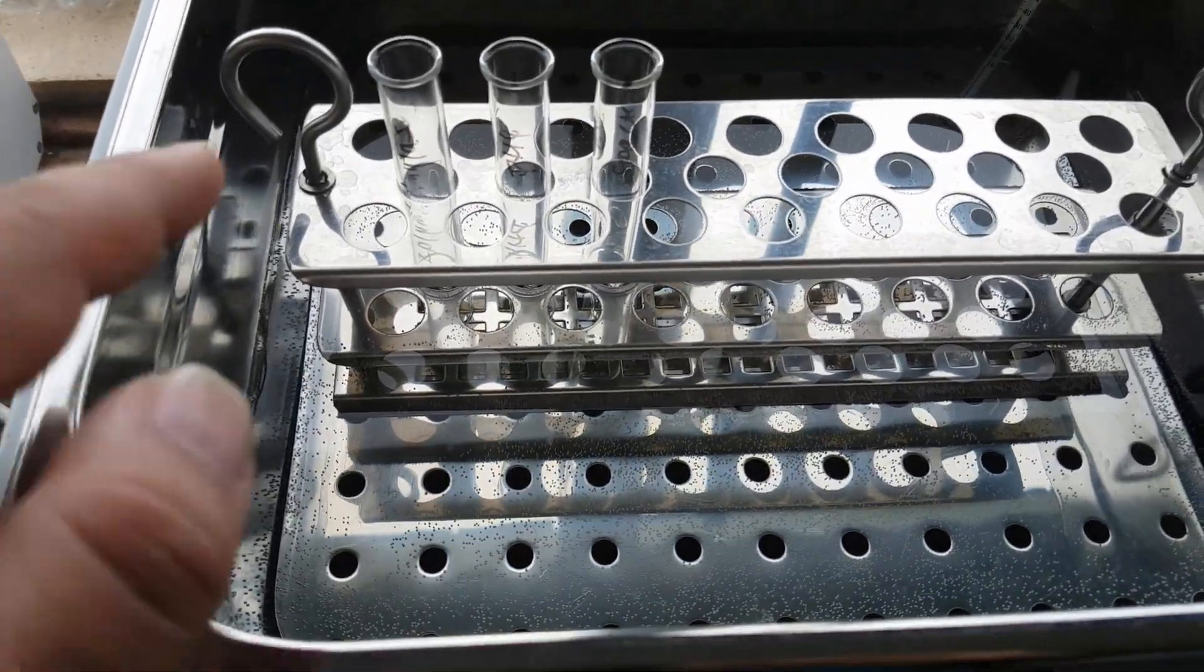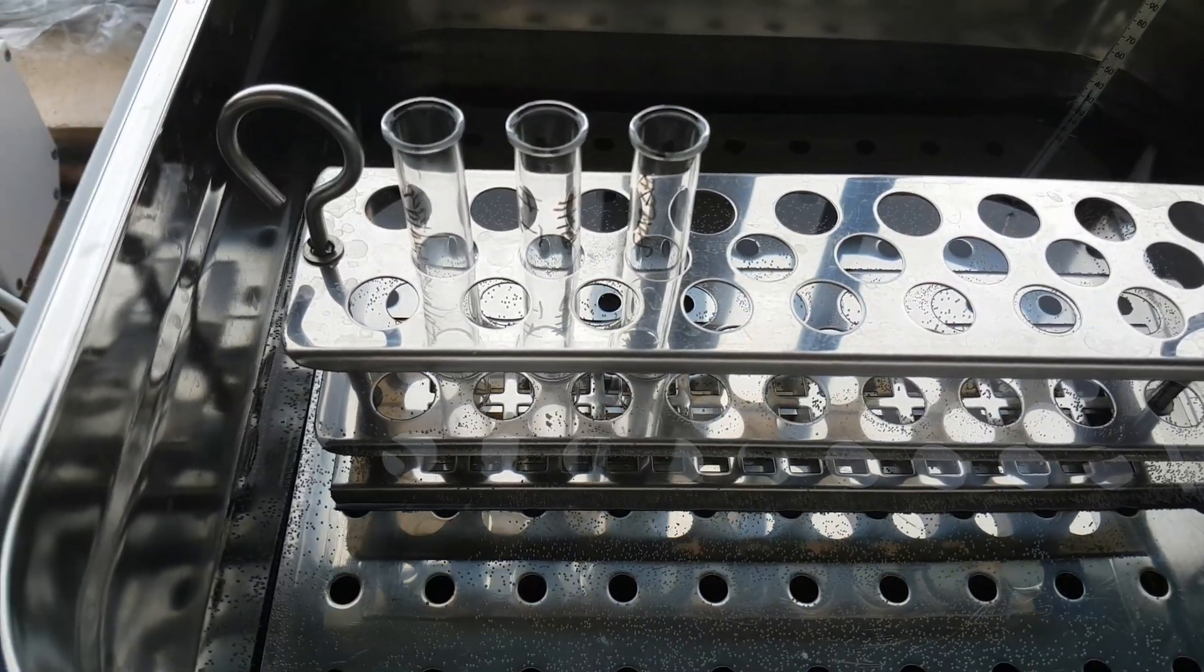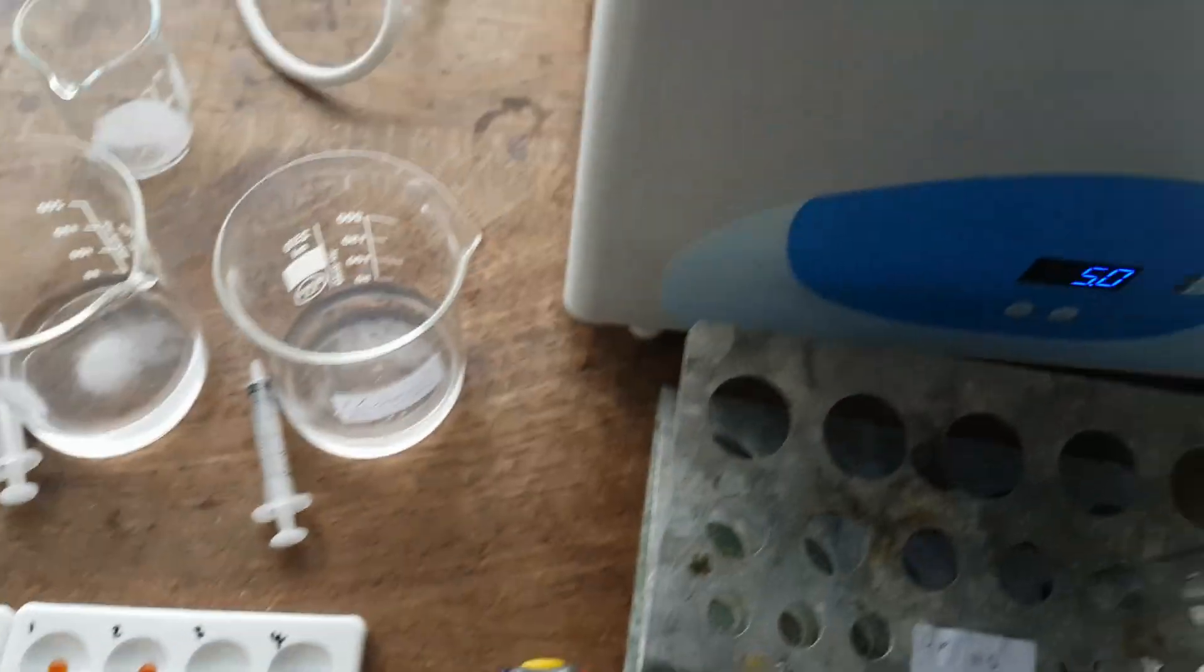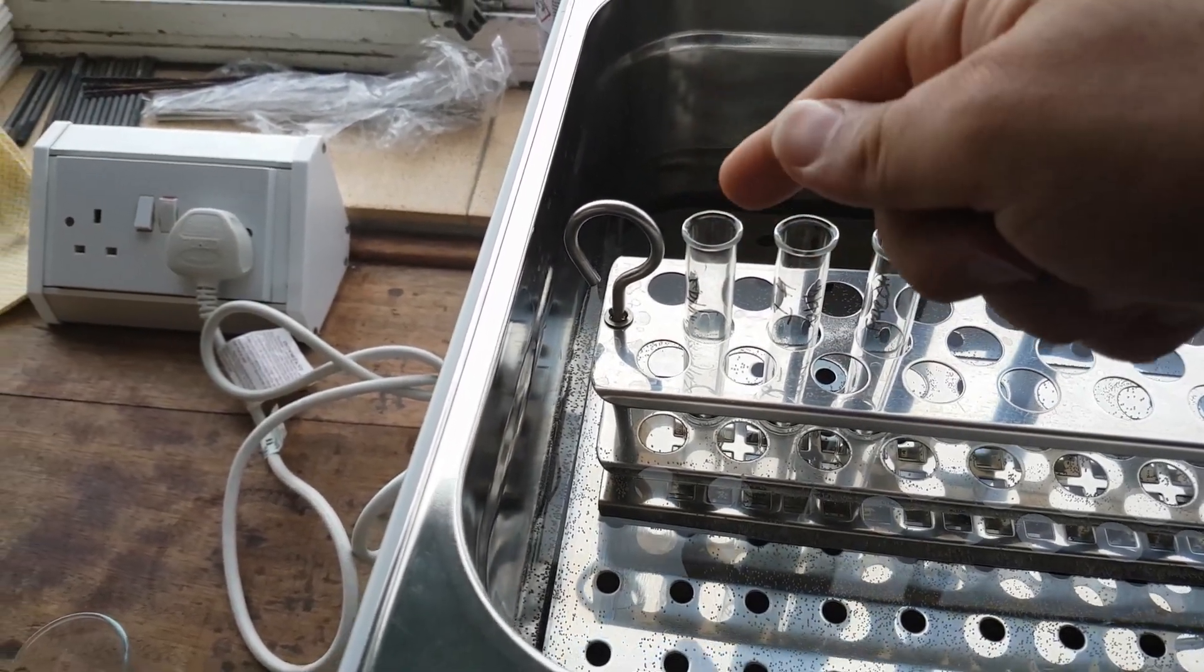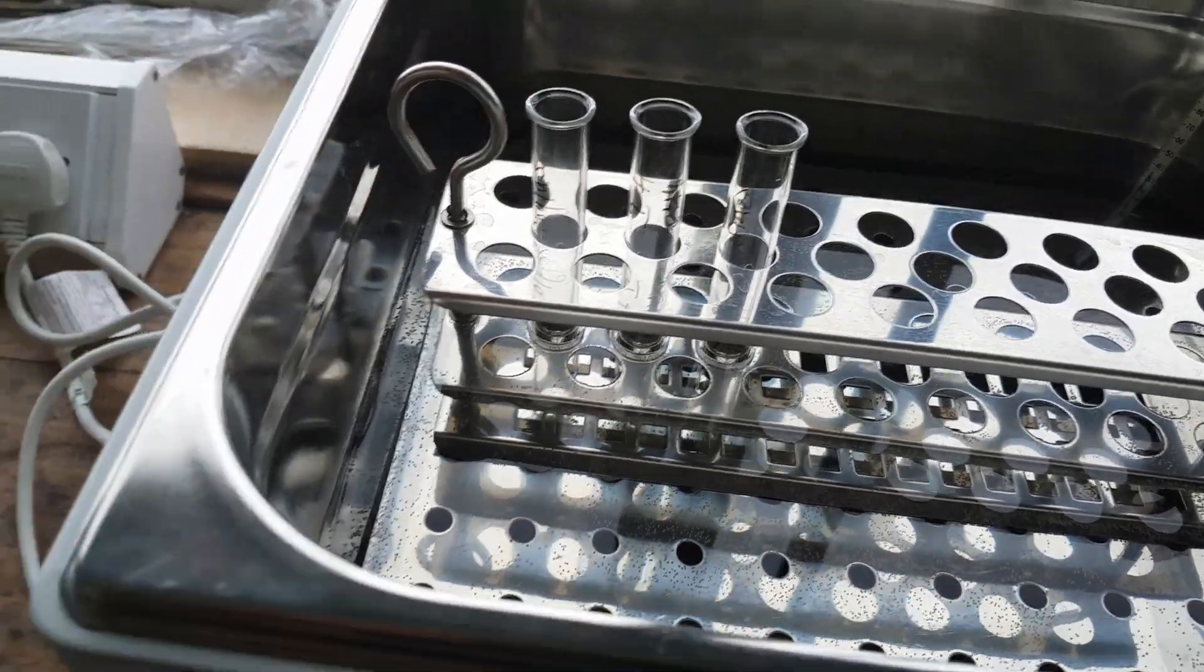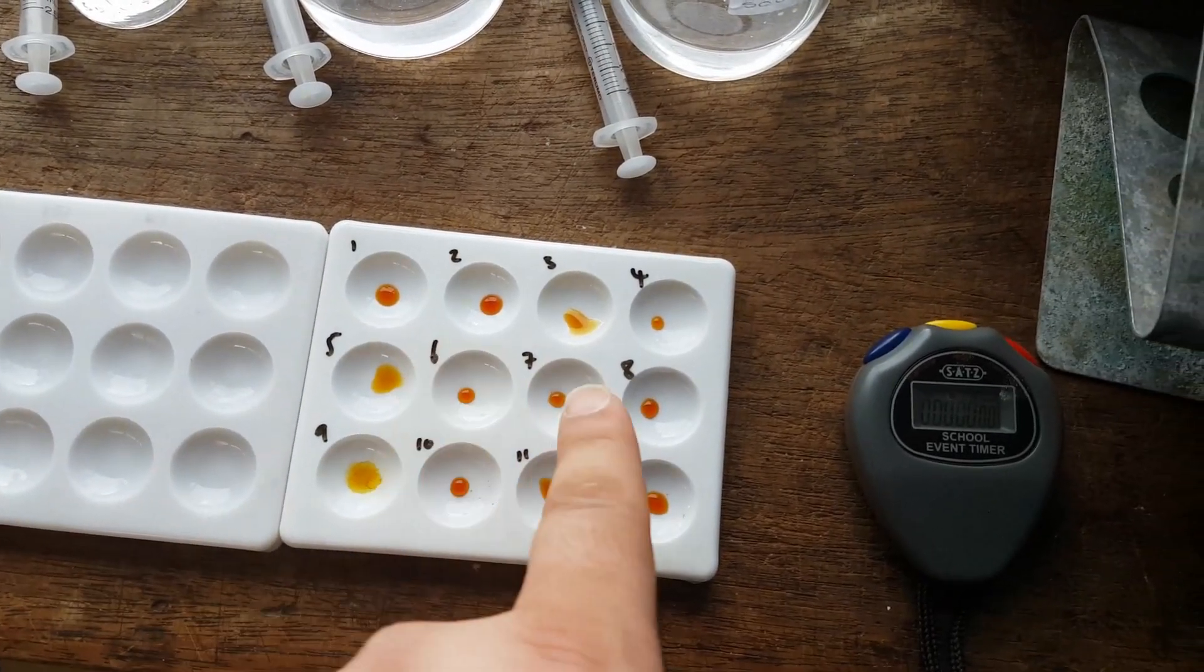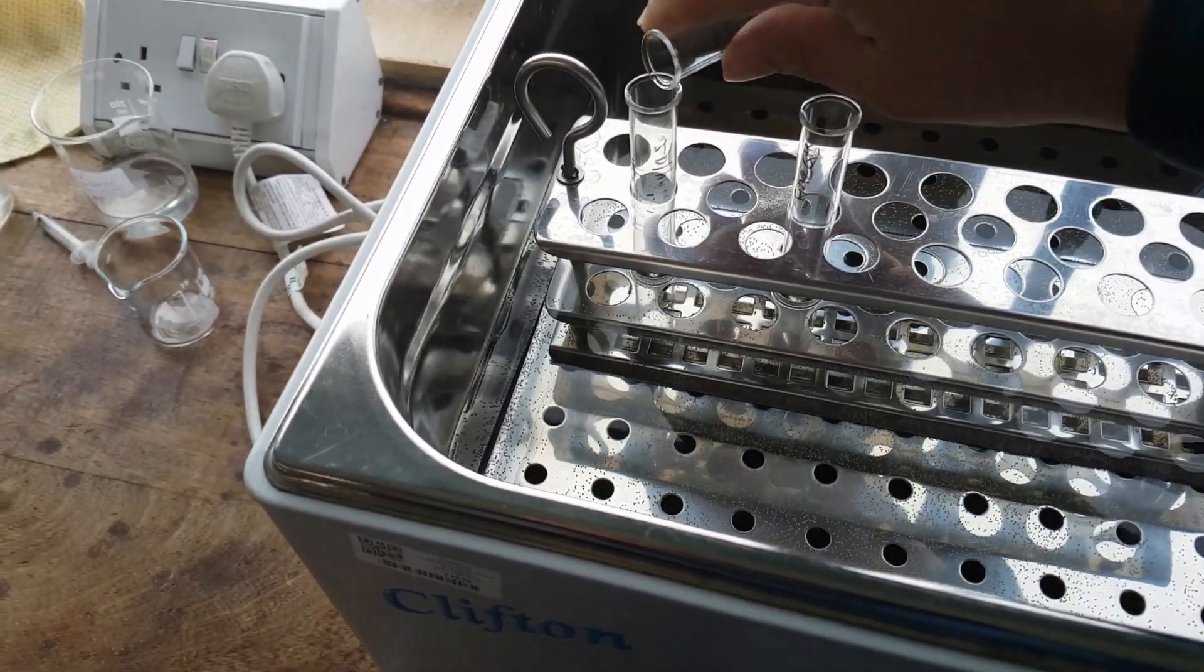Right, so that's been about a minute. What I'm going to do is I'm going to transfer all of these over into one test tube. Now, once I've done that, I'm then going to start the stopwatch. And then I'm going to straight away use a clean pipette to transfer some of that into my pipette. And then I'm going to place it onto here. And that will give me a color change. Then I'm going to continuously... Now, whatever remains in the pipette, I'm going to place back in. And then I'm going to do it again every 20 seconds. I'm going to add more in here.